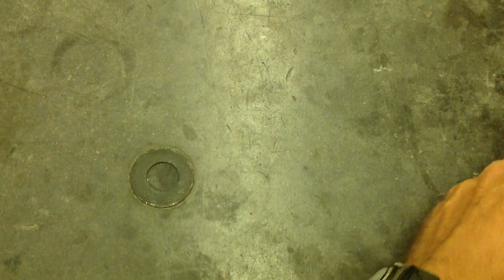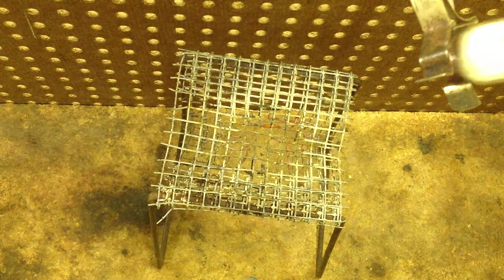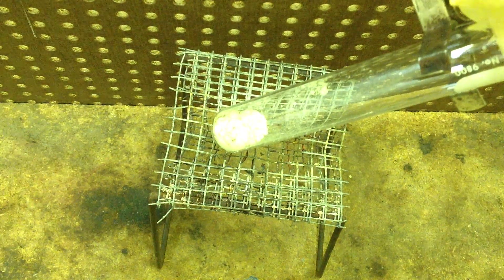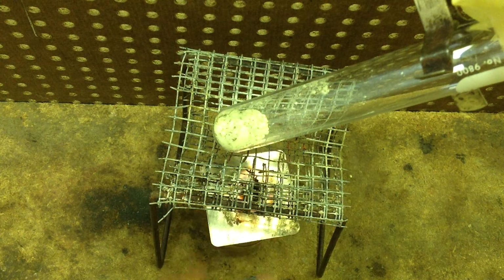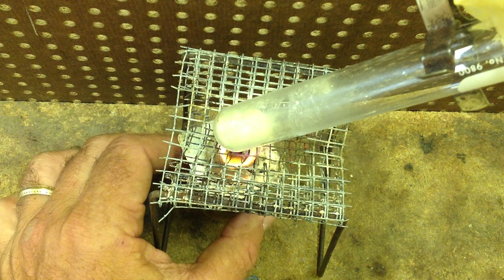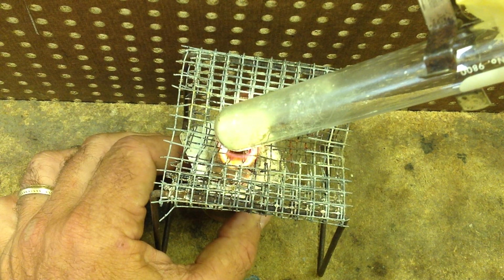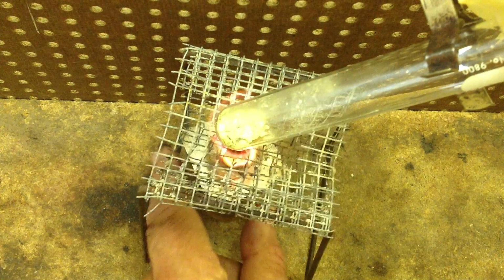It is going to be a pegboard with a gauze stand. And we slide our test tube in, just like that. We take an alcohol burner, place it under our test tube, just like this. We allow this to heat up until we see a red glow inside the test tube. That's going to take too long for our video purposes, so I'm going to pull this out.